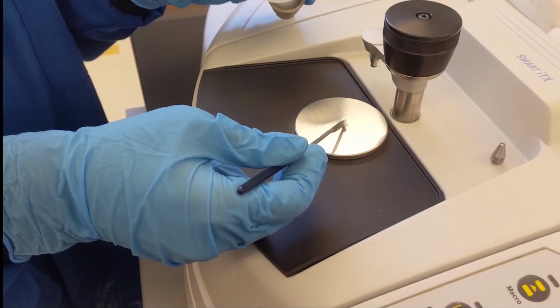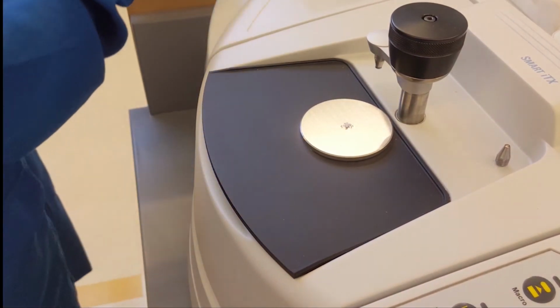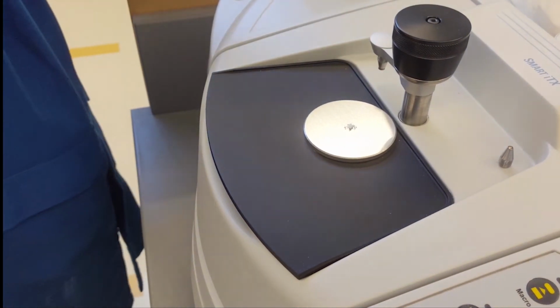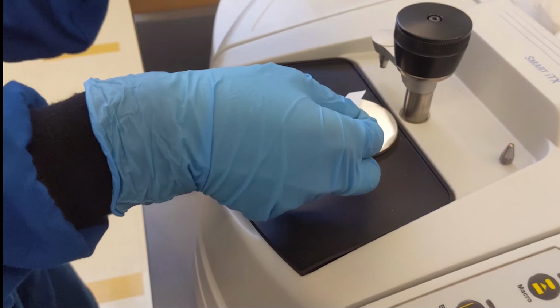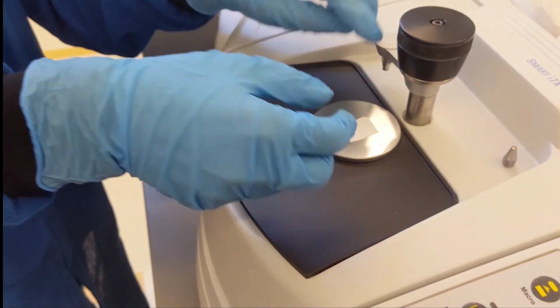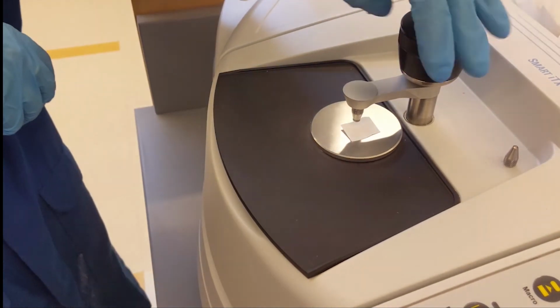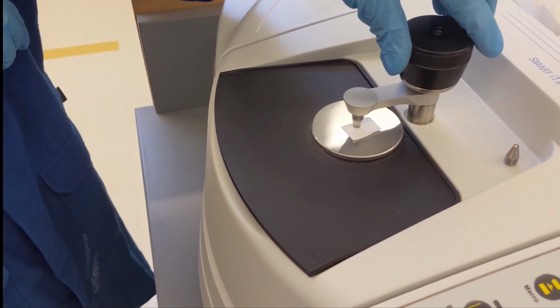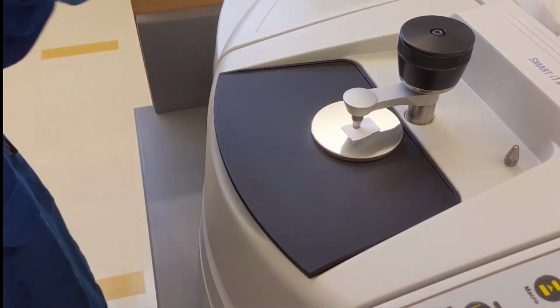Take a small amount of your solid product and put it on the small crystal in the sample holder section. Put a small piece of paper on your solid sample, screw the top until you feel some resistance. Make sure to not screw it too tightly so as not to break the crystal. Then proceed to take the sample spectrum.